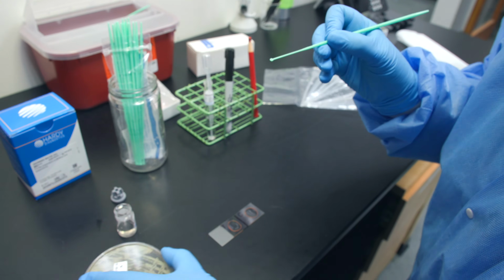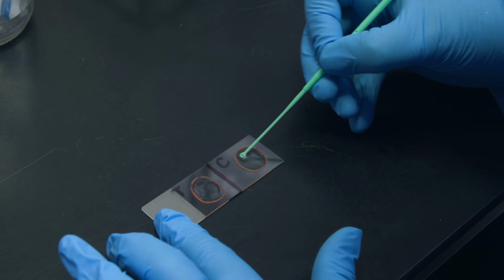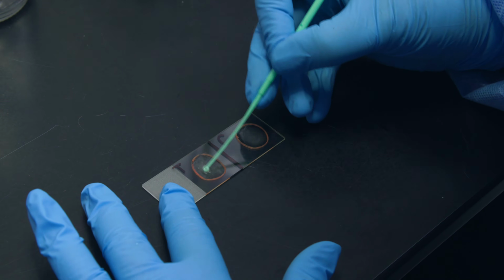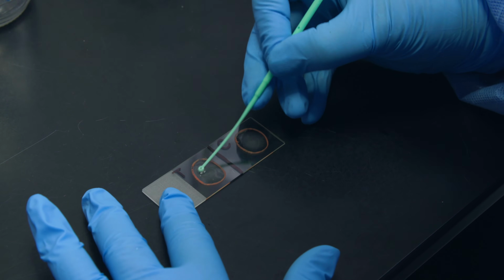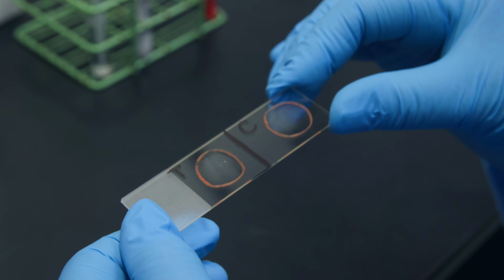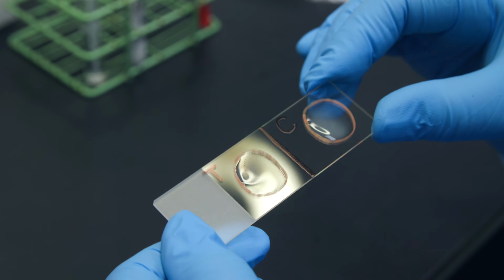With a sterile loop or wooden stick, emulsify an amount of the isolated colony being tested into each drop, inoculating the water or saline first. Try to create a smooth suspension. Do not take colonies from a mannitol salt agar plate. Observe for clumping in the coagulase plasma and a homogeneous suspension in the control.